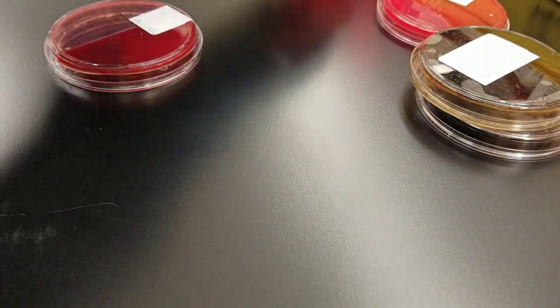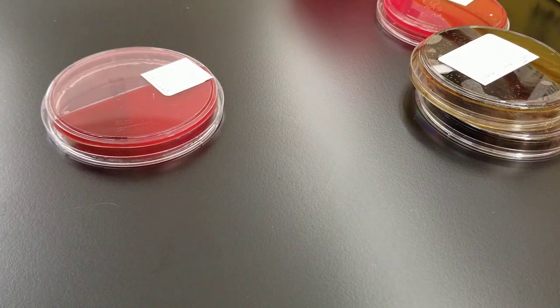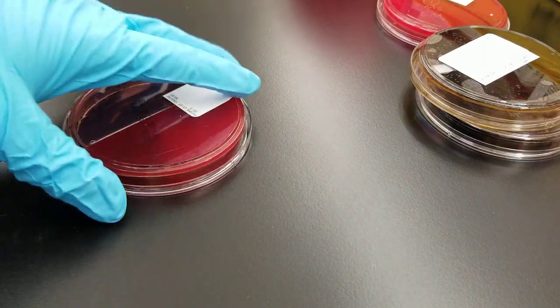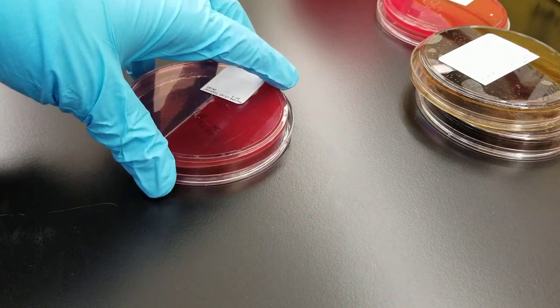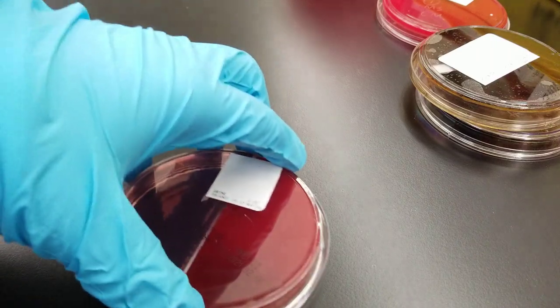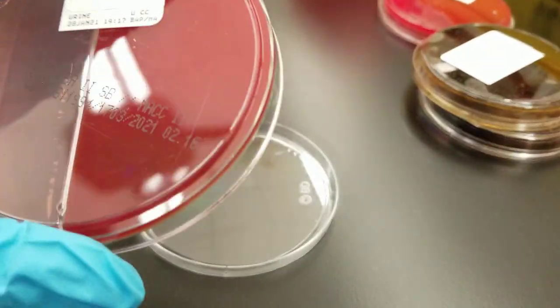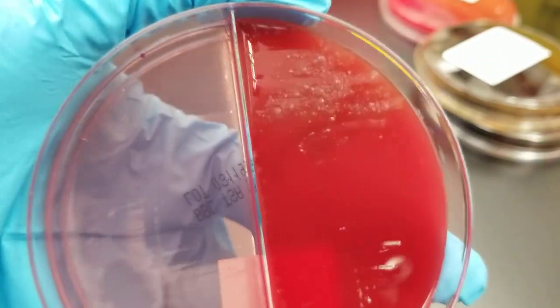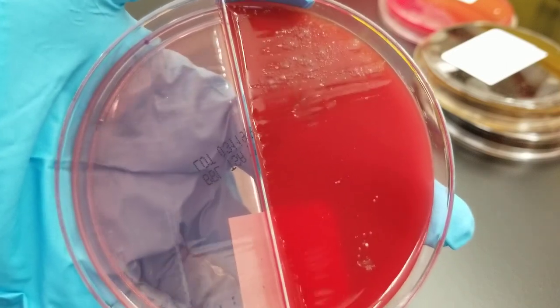Enterococcus is a cocci bacteria found in the gut. Any time gut normal flora gets into the urethra, it's not a good thing. If it's able to attach and ascend the urethra and continue up the urinary tract, that's when we get a lot of problems — you can end up with a kidney infection. This next one is another urine culture that also looks like normal flora, not really anything to write home about.